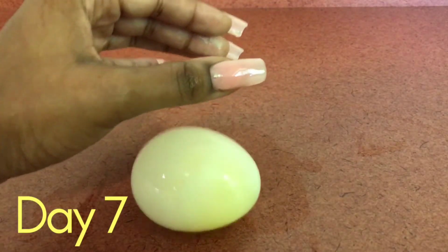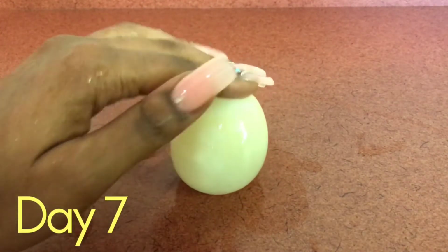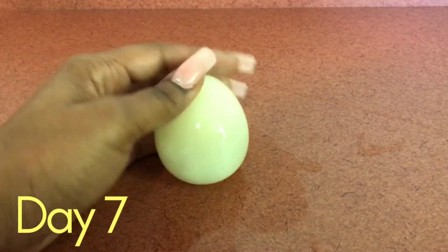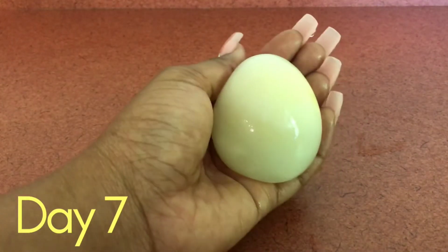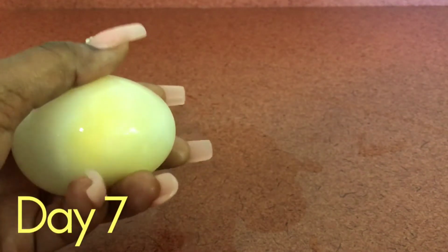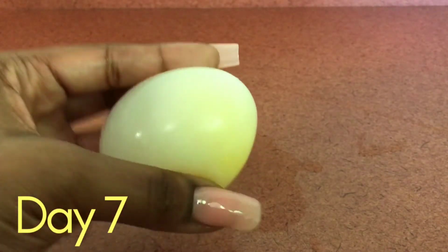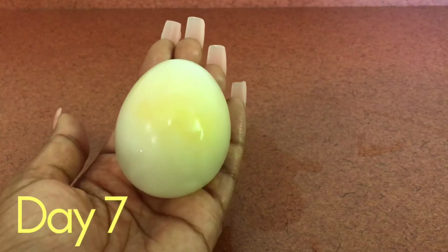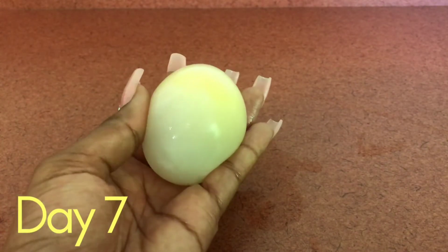This is what a naked egg looks like. And we would consider this the membrane of a cell. In our case, the egg is semi-permeable, meaning that small particles can go in and out of the cell, while larger particles stay out. Water and other nutrients are small enough to travel in and out of the cell.